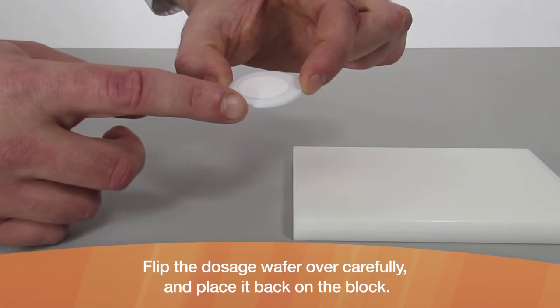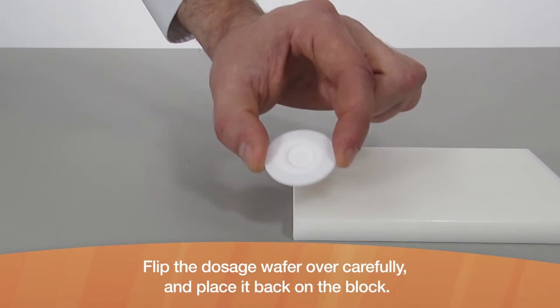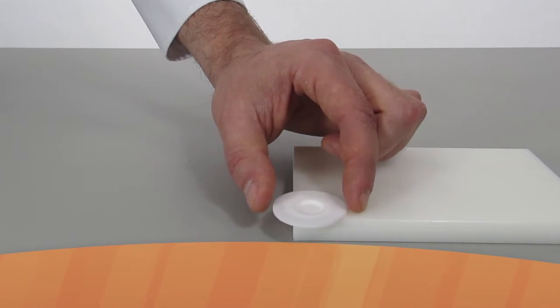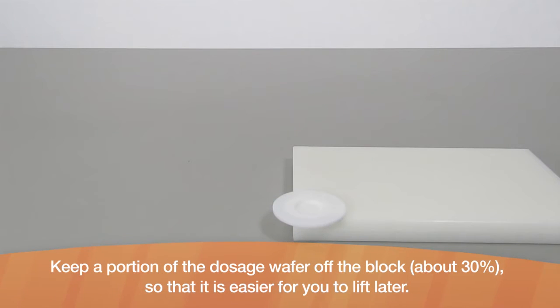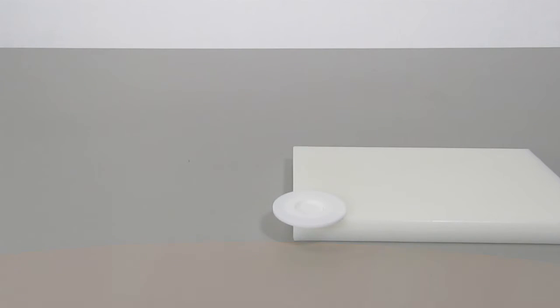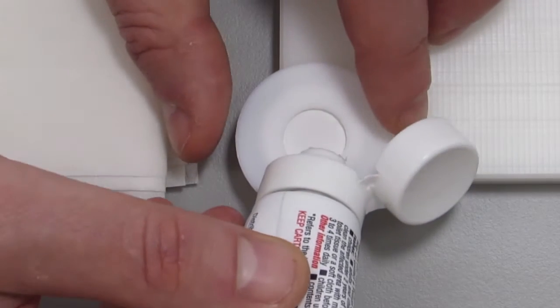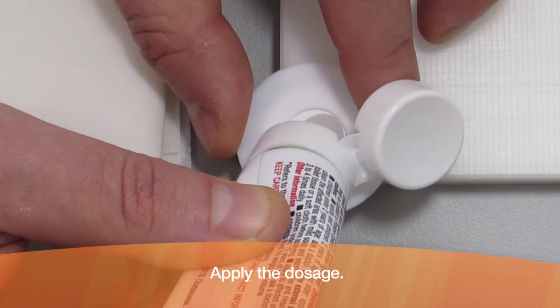Flip the dosage wafer over carefully and place it back on the block. Keep a portion of the dosage wafer off the block so that it is easier for you to lift later.